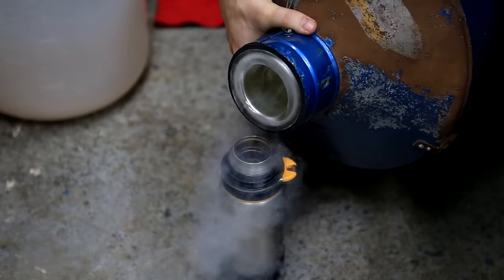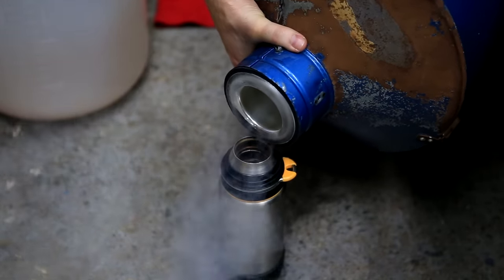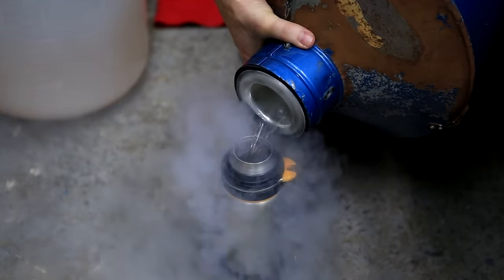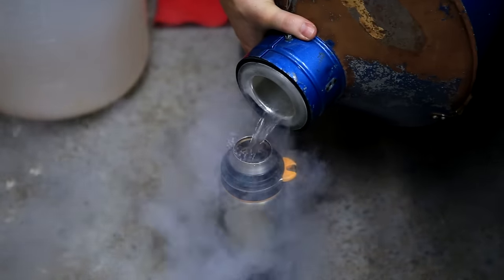So now liquid nitrogen is transferred from the large dewar into a vacuum thermos. The liquid nitrogen will initially boil a lot as it cools down the inside of the thermos.